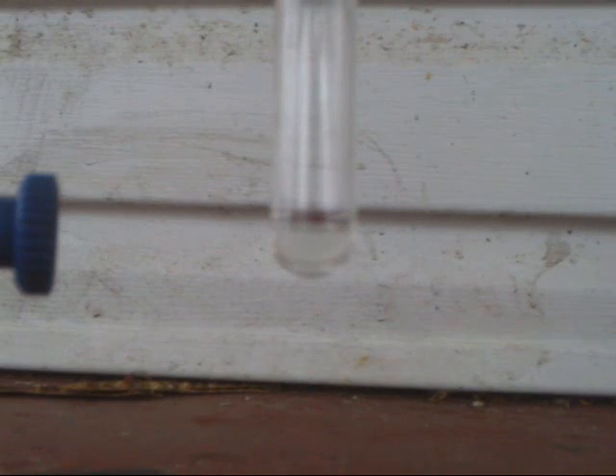Now I am showing you my hydrochloric acid. It is toxic, and you should be doing this in a fume hood. I'm going to be adding aluminum to it, and this reaction has to be performed outside or in a fume hood. I'm making a fume hood right now, so I really can't — I have to do it outside.